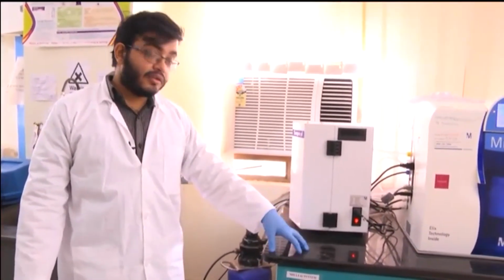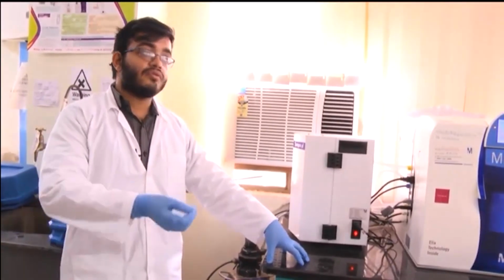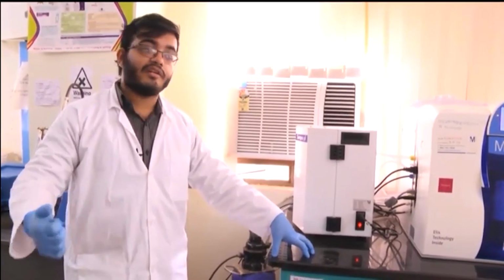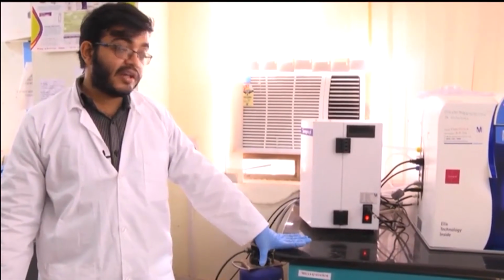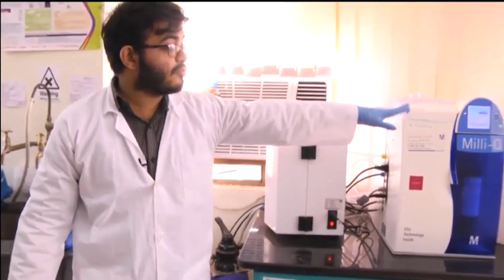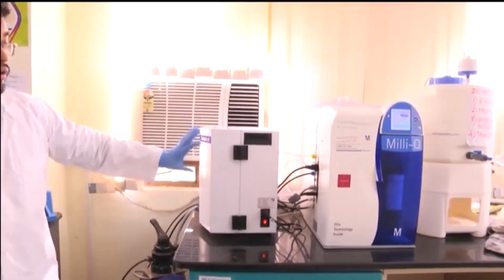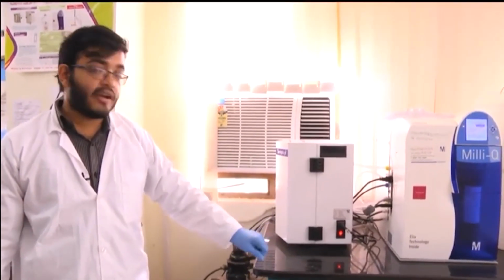Another very important and basic requirement for molecular biology or biochemical experimental work is the usage of proper quality of water. You cannot just use tap water and carry out different reactions or carry out different experiments, because you do not know what ions or minerals or what the pH of the water in the tap is. So, for that purpose you will require deionized water, and what I have in front of me are a set of different instruments, this one, that one, all of which are working in tandem to provide us with deionized water, purified deionized water.